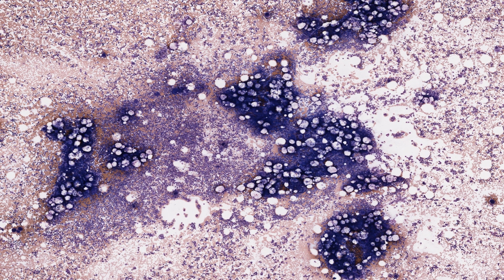Hematopoiesis in bone marrow can be studied either in histological sections or in smears. The earlier image I showed you of the blood sinusoid was from a histological section through the marrow in the vertebral body. Bone marrow smears, made in a way similar to blood smears, allow a greater degree of differential staining than is possible with histological sections.